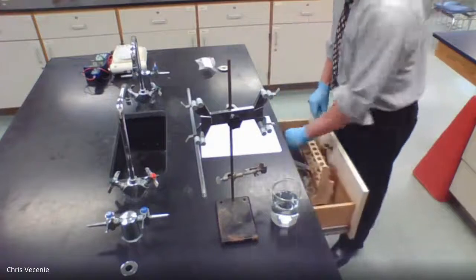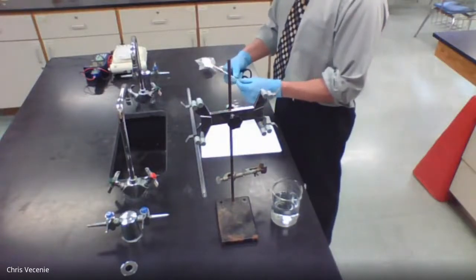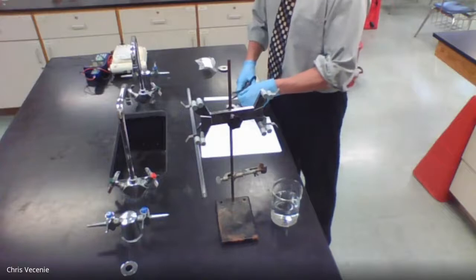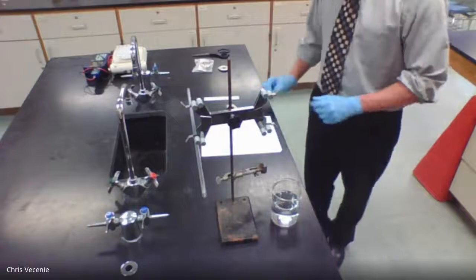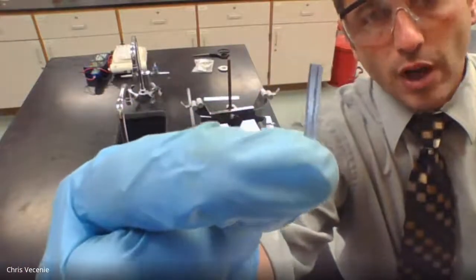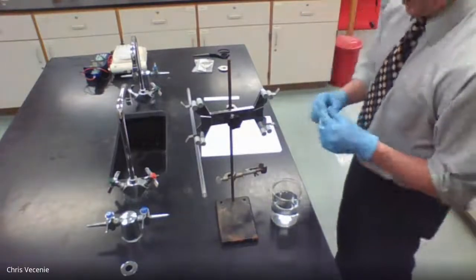All right, so we go in our drawer. We get our centimeter ruler. And we're going to measure out a piece 3 centimeters in length, and we're going to cut right there. Now, you want to make sure you have a nice flat edge on that, because if it were curved like this, you wouldn't be getting all of it. You'd be missing magnesium from that process.